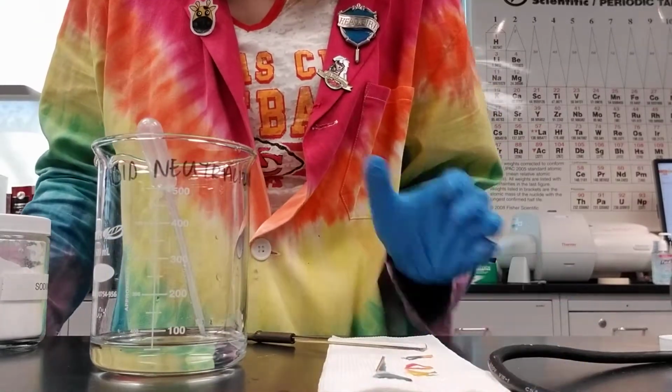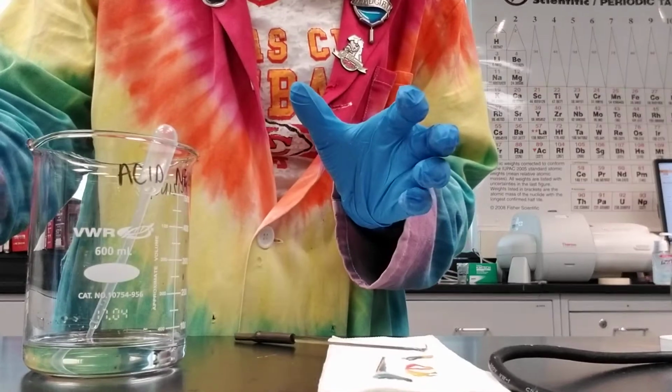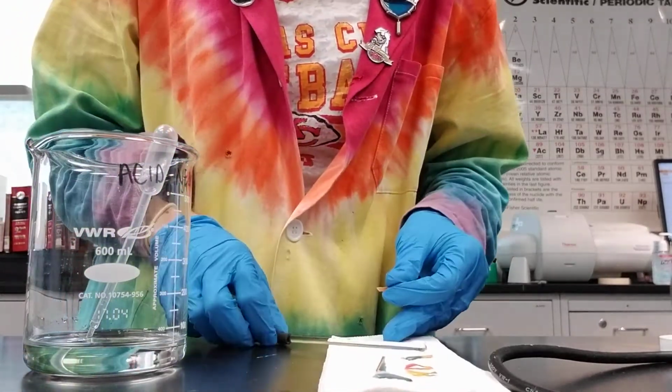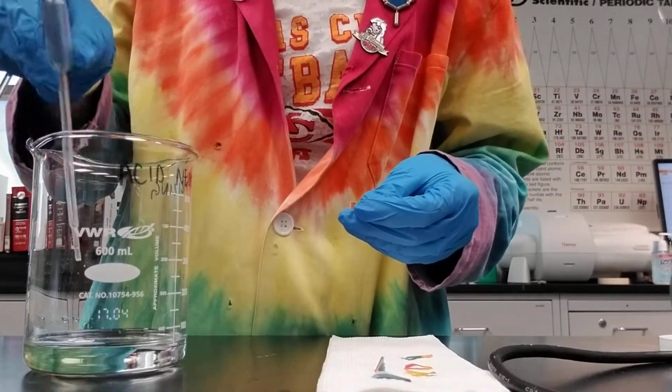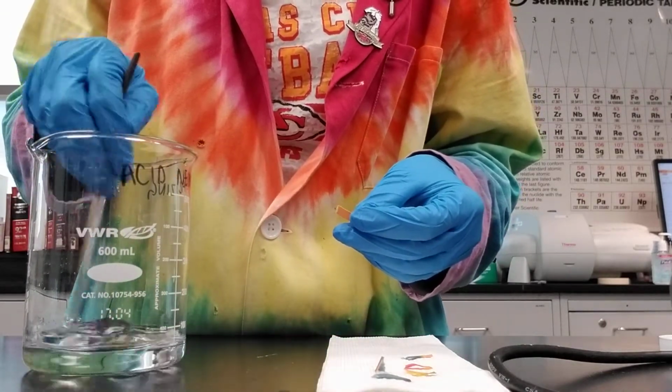This video is for neutralizing solutions that are acidic. So if you are told in the lab procedure that you need to neutralize your waste at the end of the lab, that means we need to get the pH to a value of 6, 7, 8, or 9.